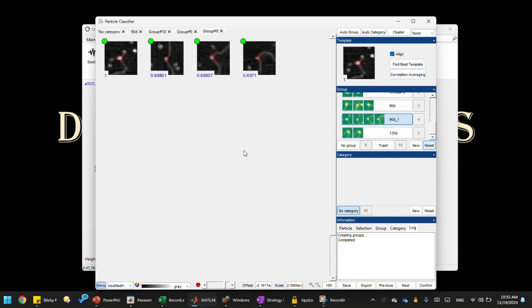I think that's all for this video, demonstrating how to use particle masks as a potential solution to classify DNA bending conformations. So that's, I think, a powerful technique, especially for high throughput analysis, right? If you have a lot of images, a lot of particles, you can do this very quickly, and the program can do the cluster analysis, and as you see, it clusters them very well. I don't have to do any manual job. I just check them, then name those classes, right? And it already does a pretty good job in resolving the different bend states, right? So it's a very powerful technique that complements existing bend angle analysis.